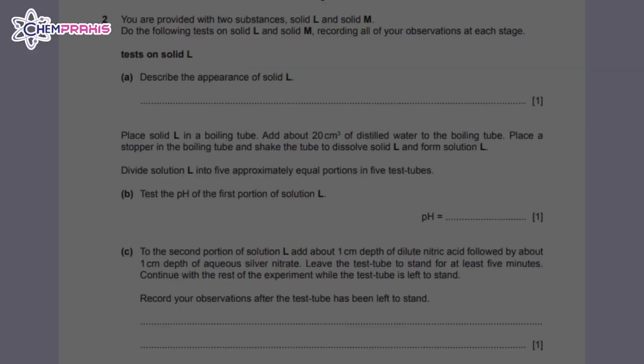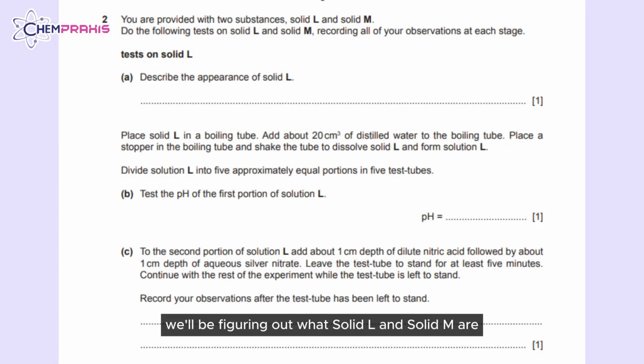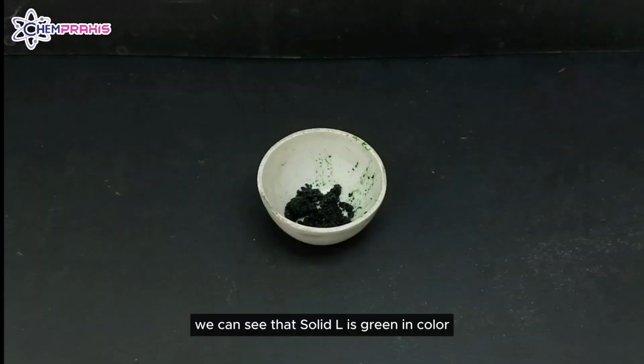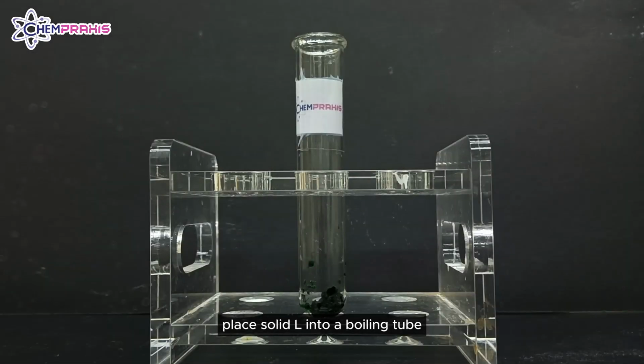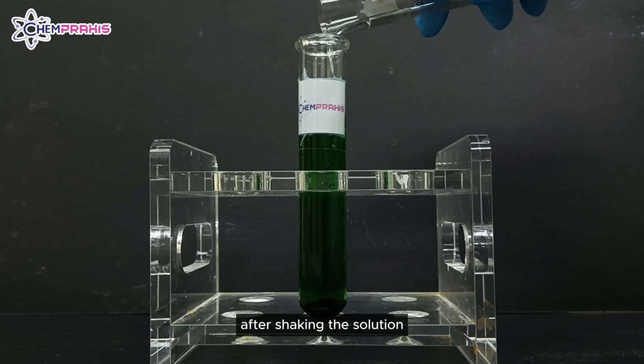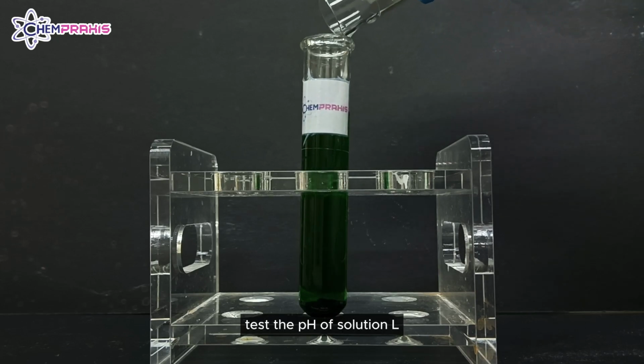For question 2, we'll be figuring out what solid L and solid M are. We can see that solid L is green in color. Place solid L into a boiling tube and pour 20 milliliters of distilled water into the boiling tube. After shaking the solution, test the pH of solution L.